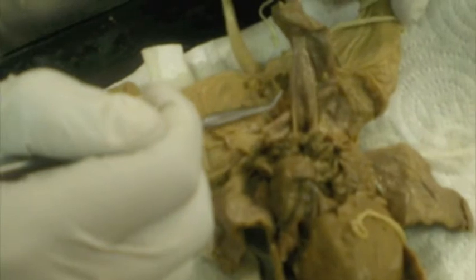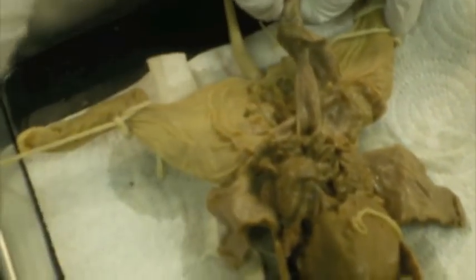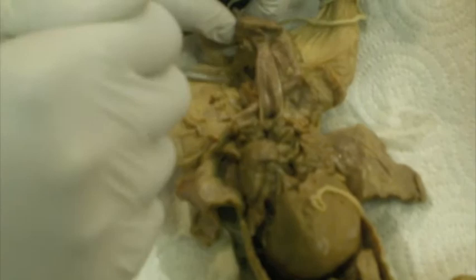Now, in the umbilical cord, there's the umbilical vein and the umbilical artery. The umbilical vein supplies oxygenated and nutrient-rich blood from the placenta to the fetus, while the umbilical artery takes the deoxygenated blood, which is full of waste products, out of the umbilical cord into the placenta, which then diffuses out to the mother, who then gets rid of the baby's waste.